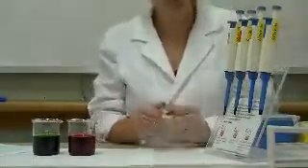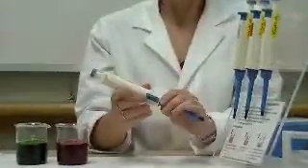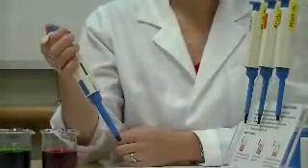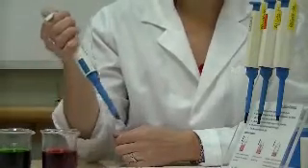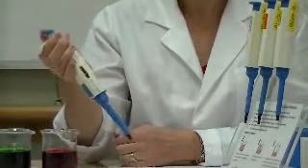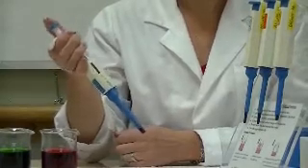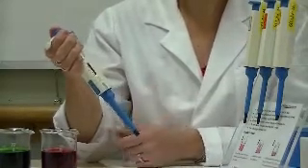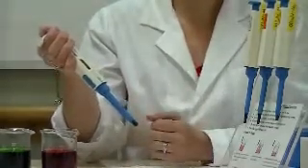So let's have a look at the pipettes and the different parts of them. First of all, we have the plunger here. This can be depressed to allow liquid to be drawn into a pipette tip and then depressed again to eject that, to expel that solution into a new vessel. You'll feel when you pick up the pipette that there are two stops. The first stop you use to draw solution into the tip, and the second is used to make sure that you expel all the solution out of the tip.